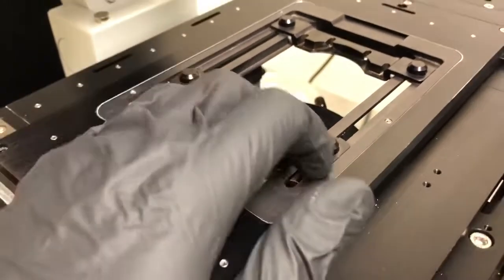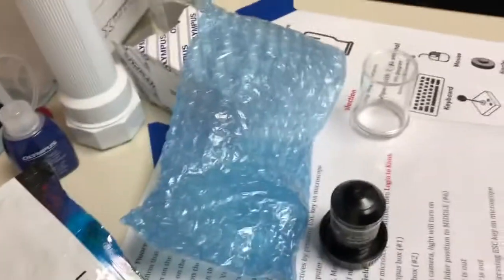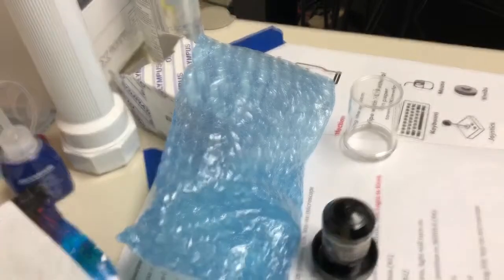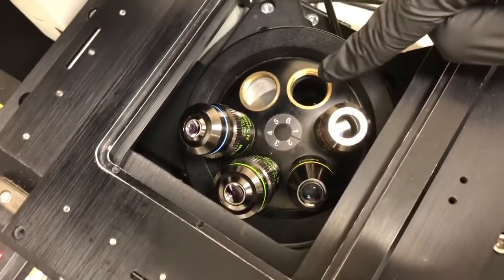We typically want to remove this to give ourselves more room to put on that objective. Then we'll remove the objective from this holder and screw it onto this position here.